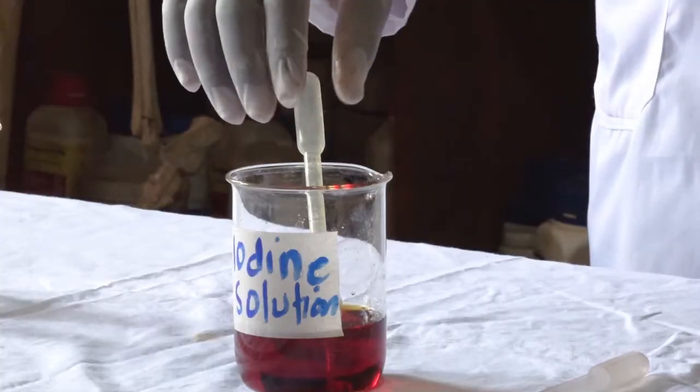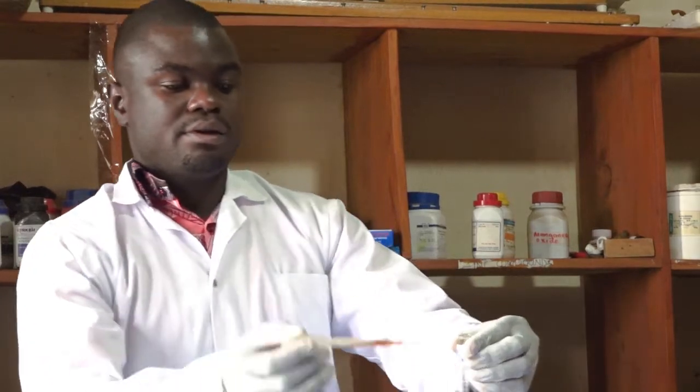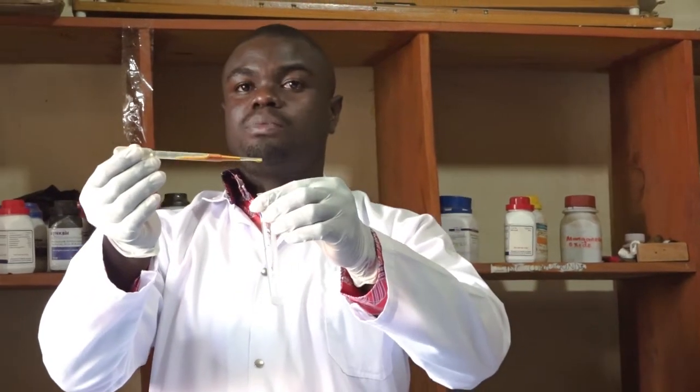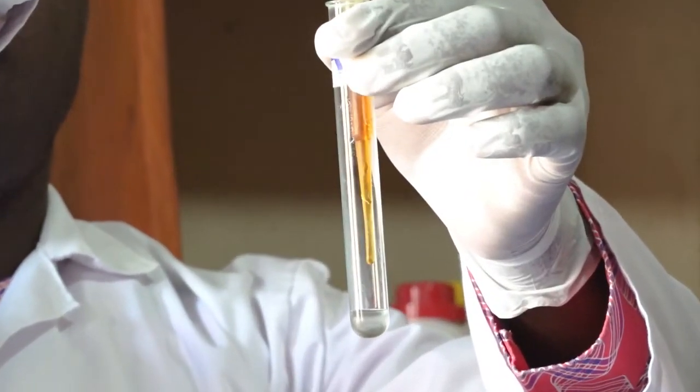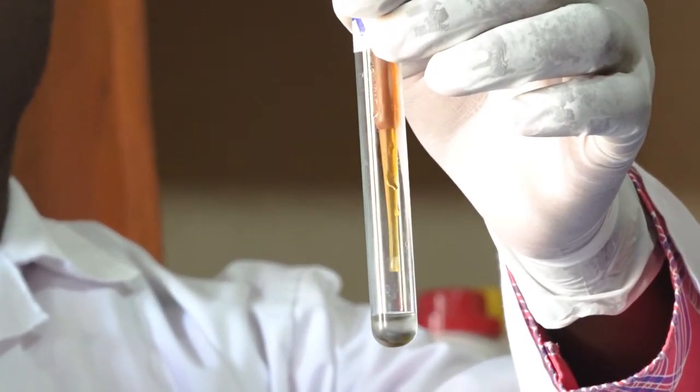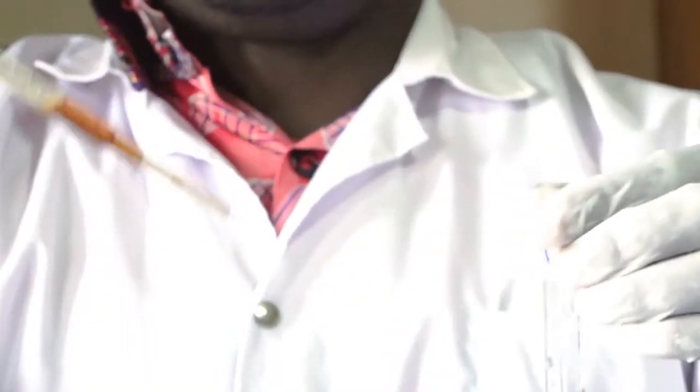I get my dropper and make sure you direct the dropper towards the inside of the test tube. And this is what we mean. Then we count one, two, and three. There you go.